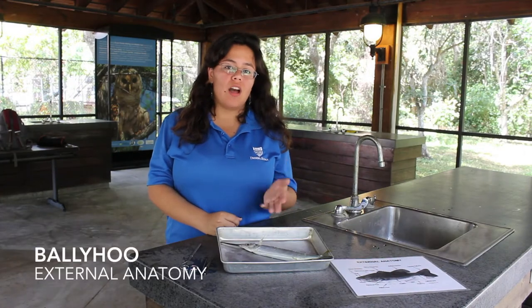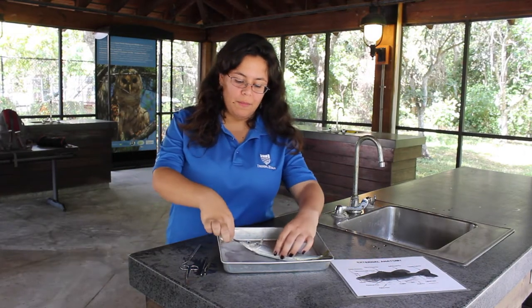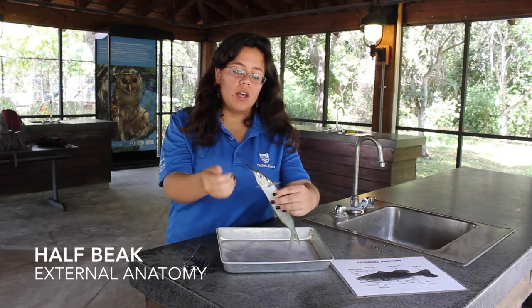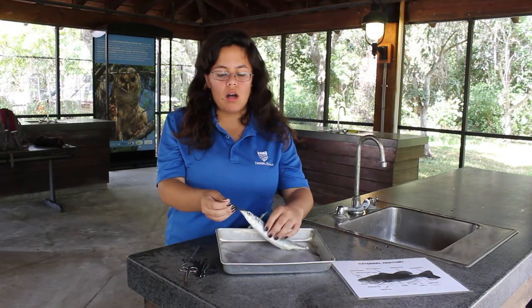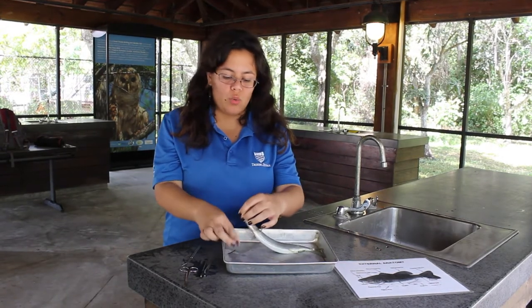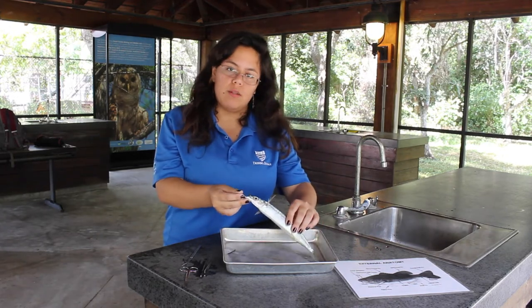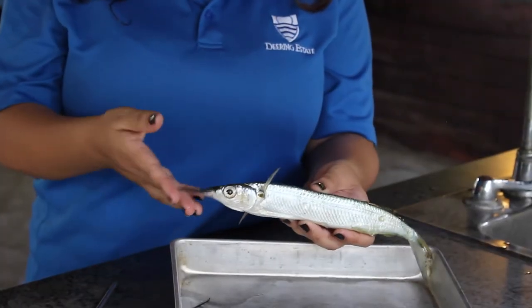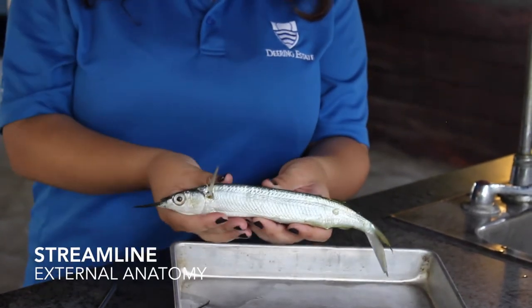This is ballyhoo, a common shallow water bait fish. You can see here that it has a half beak — it is attached to their bottom jaw. Scientists still don't really know what it's used for. It's easily broken, so we know for sure that it's not used to puncture prey items. Another hypothesis is that the beak may be for streamlining the body of this fish because it is very fast.